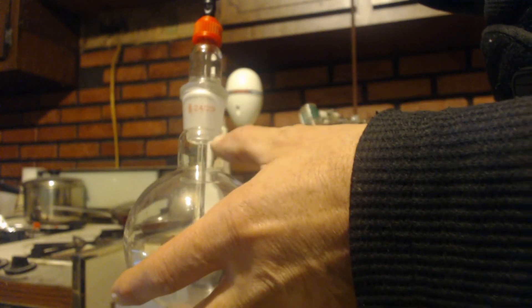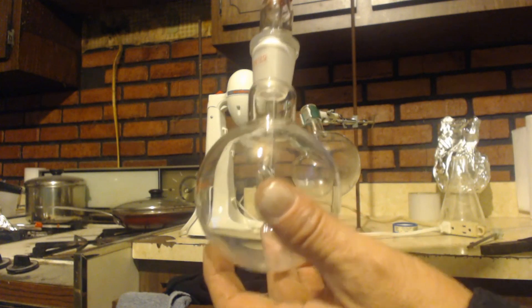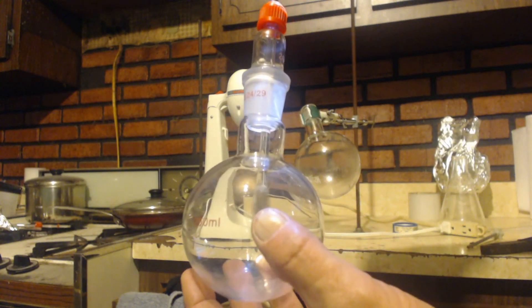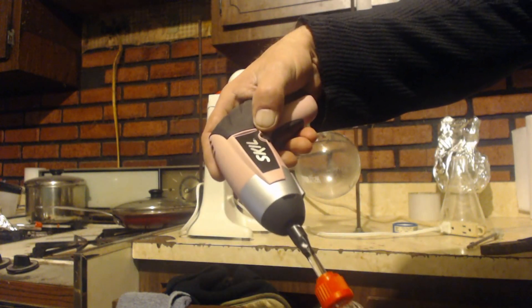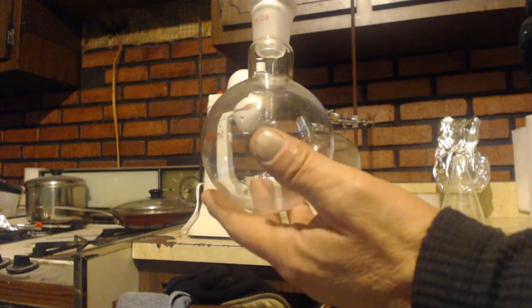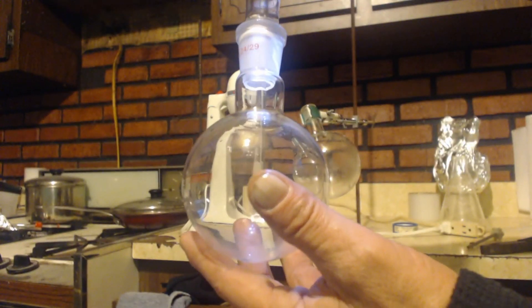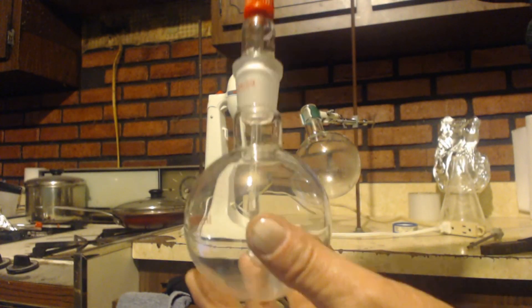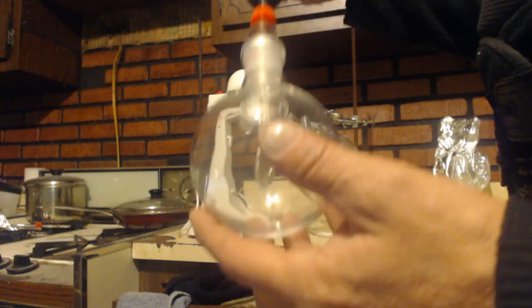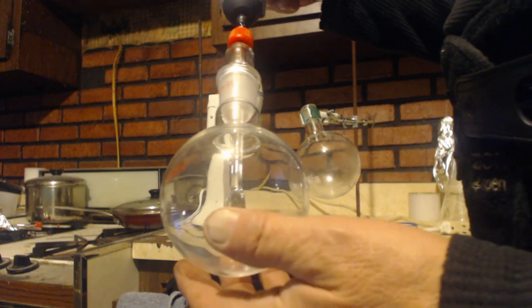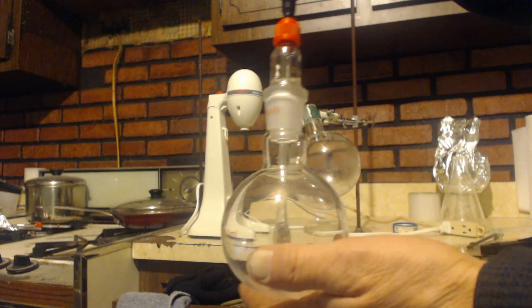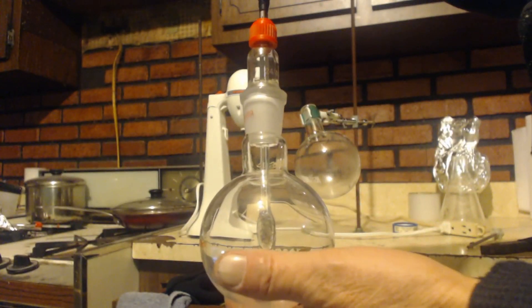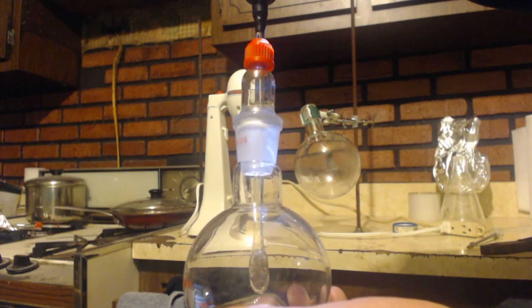And you can still have it turning because this is a cheap drill, it's not like going out of control or whatever. It's powerful enough to turn, it doesn't matter how much solids is in there, it's going to spin, but it's not too powerful. That's all the power it has.